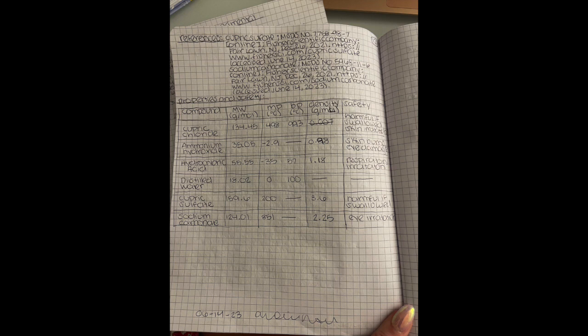Okay, this is my second page in my lab notebook for lab number 2. This page has my references continued since I couldn't fit all my references on one page. So I have that at the top, and then my property and safety table at the bottom, and that contains each of the compound names, the molecular weight, the melting point, boiling point, density, and the safety for each chemical that I referenced and each chemical that I used in this lab.